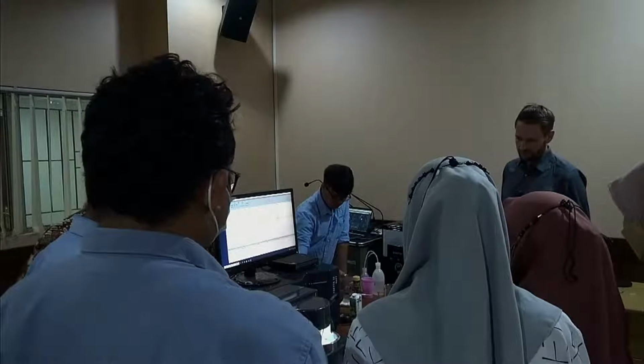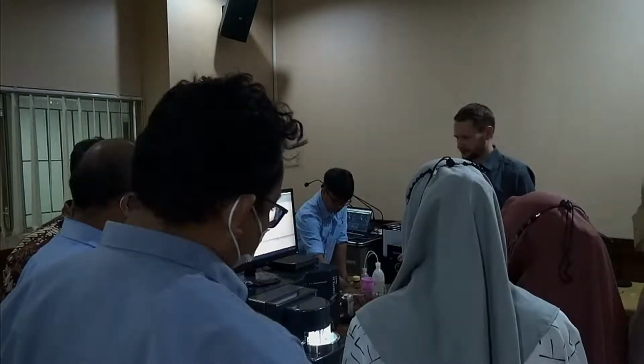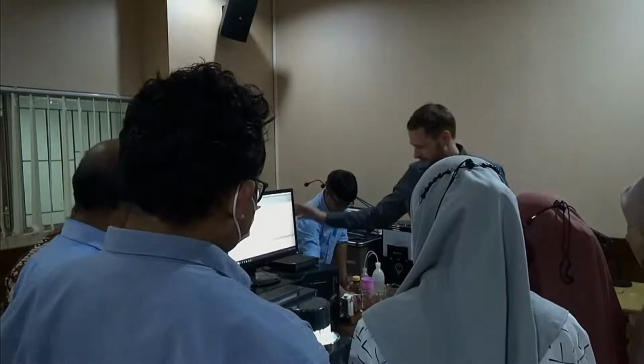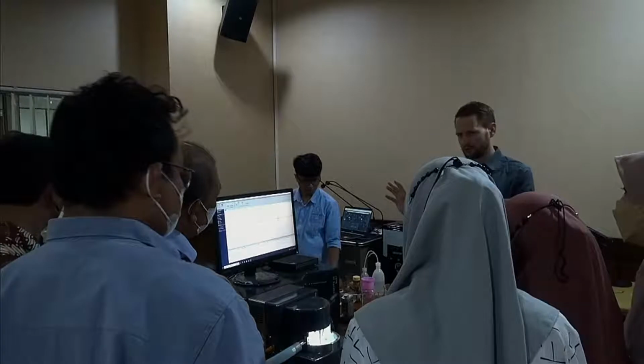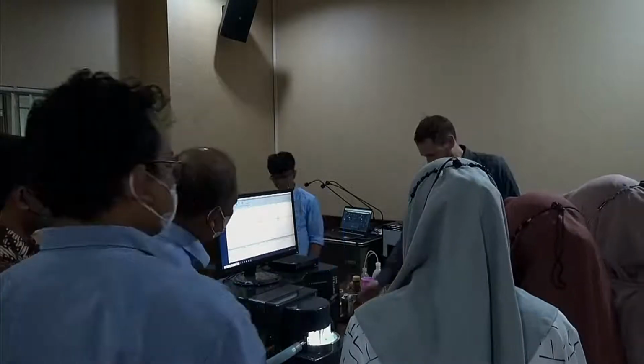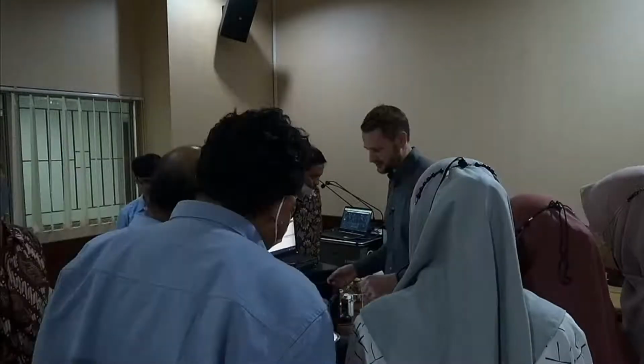It comes, of course, in a box, but once you take everything out, you'll have what you see here. So fully equipped with a monitor, with the computer, pre-installed software. So you just plug it in, start the software, you're ready to go. You get the keyboard, the mouse. One thing you see here, we mentioned the ultrasonic box. So this is just attached here to the back of the dispersion unit. So it's a module.